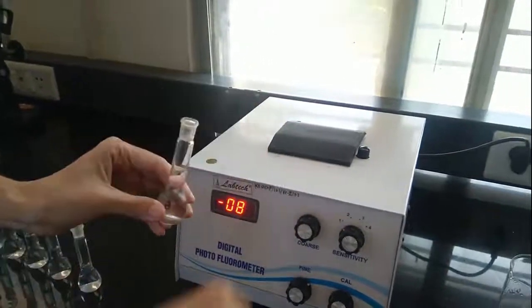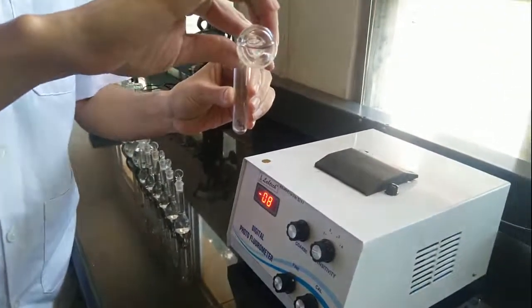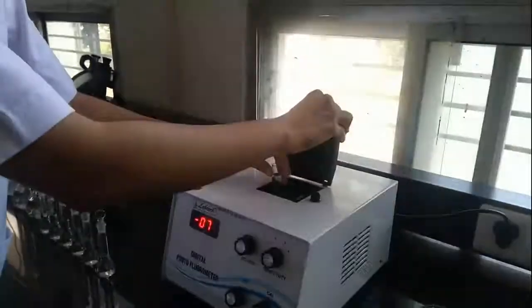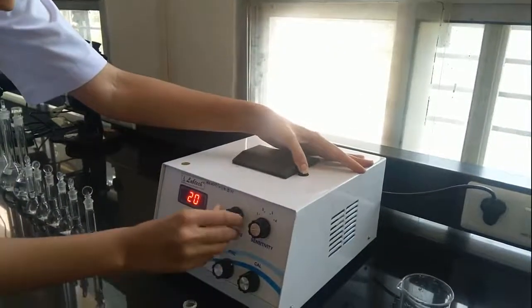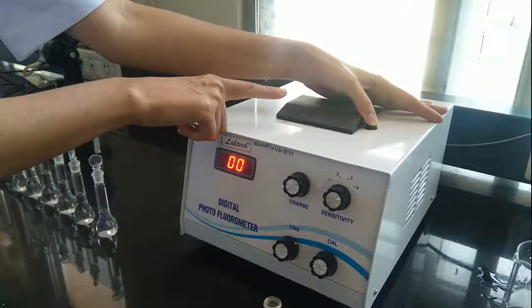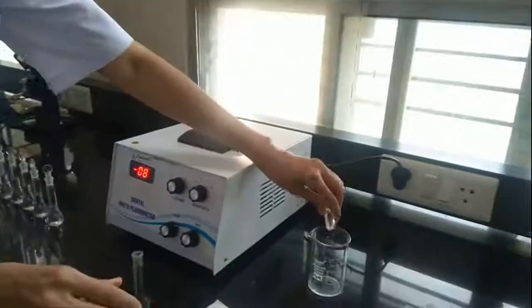Now we are going to record the readings. First, we will set 0 with the blank, which is 0.1 normal H2SO4. Fill the cuvette, place the sample holder, press the button, and set 0 using the coarse and fine adjustment. We have adjusted 0 with the blank, that is 0.1 normal H2SO4. Now we will discard this into the waste.